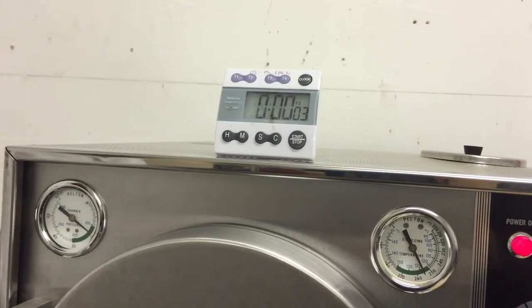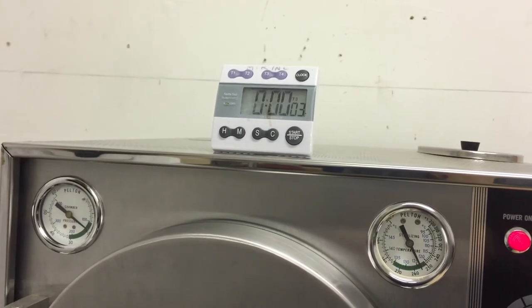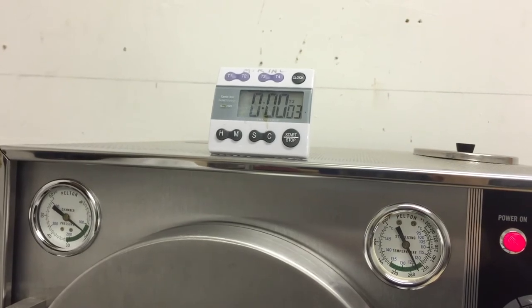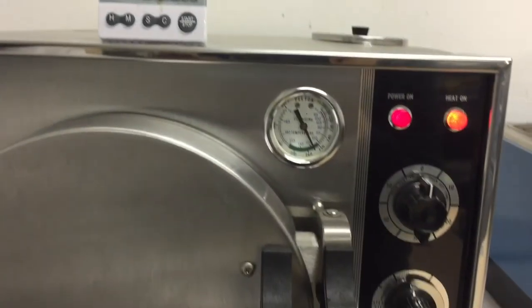After the completion of stage 2, the sterilization cycle ends. The chamber is cooled to room temperature over the next several hours.